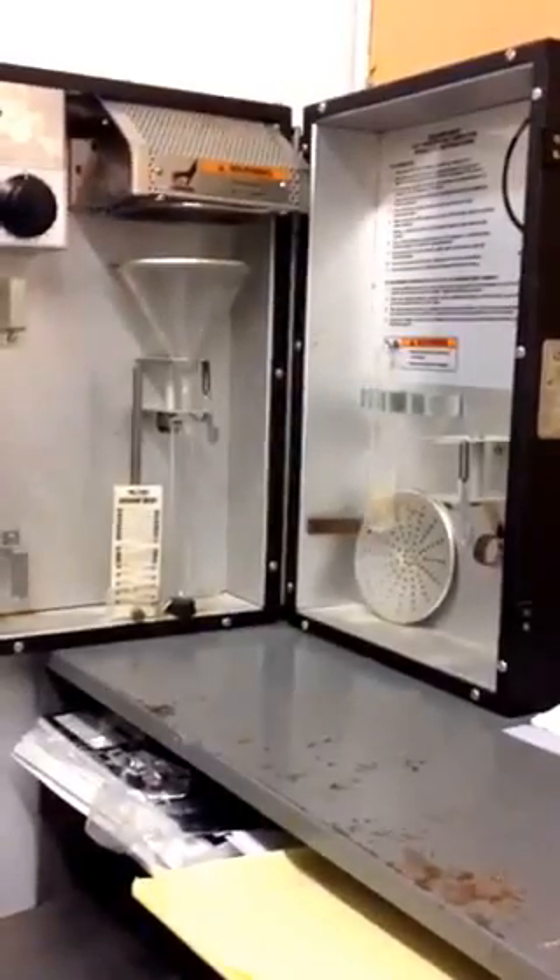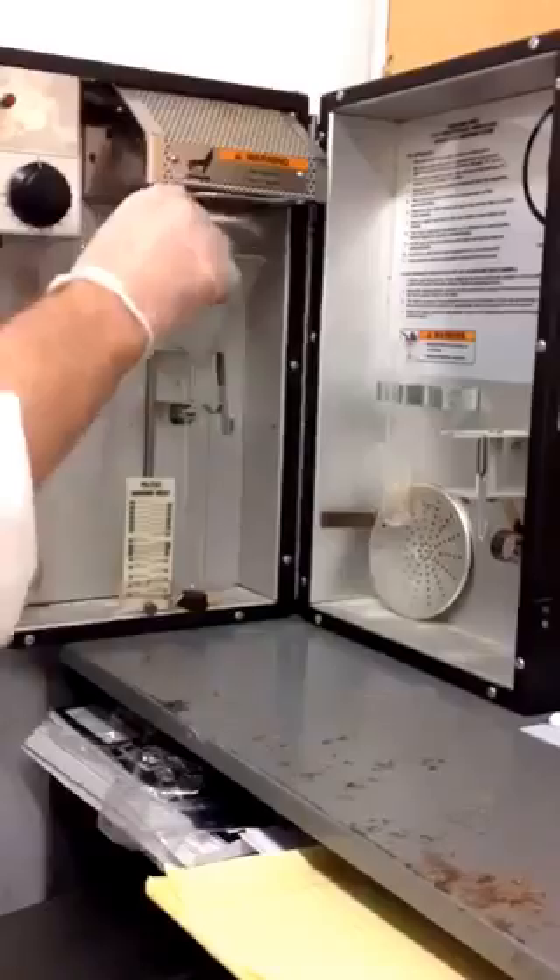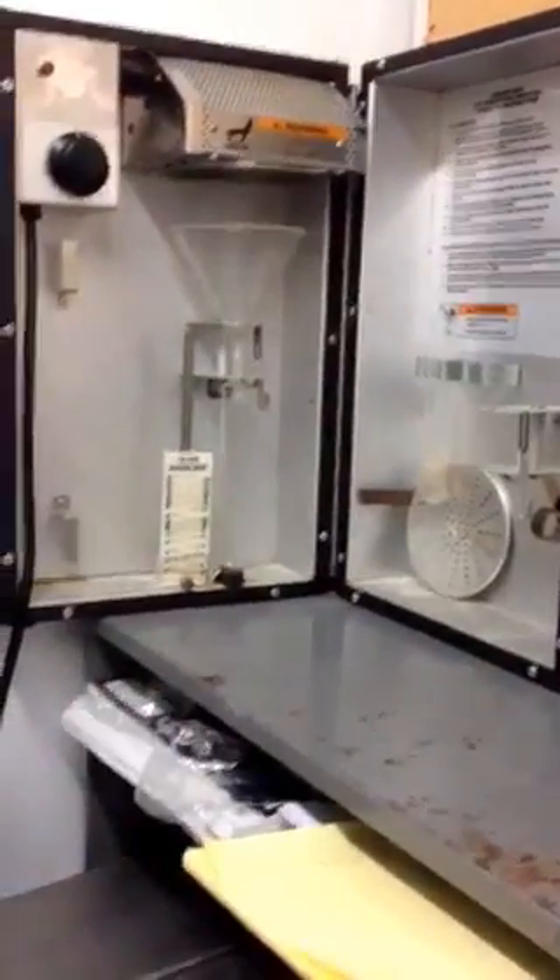Burger, 73%. We take a two and a half ounce burger, which is .13, and we get the plate.